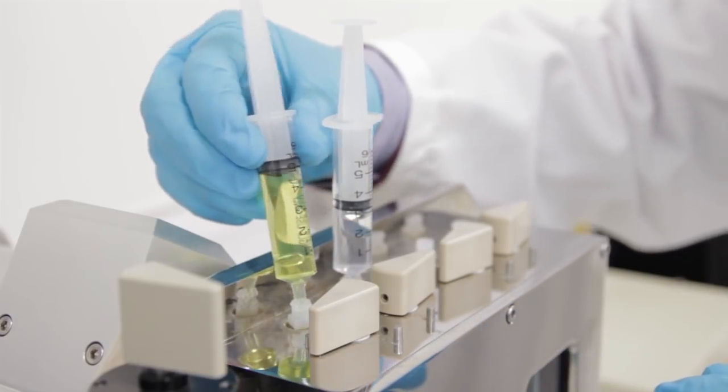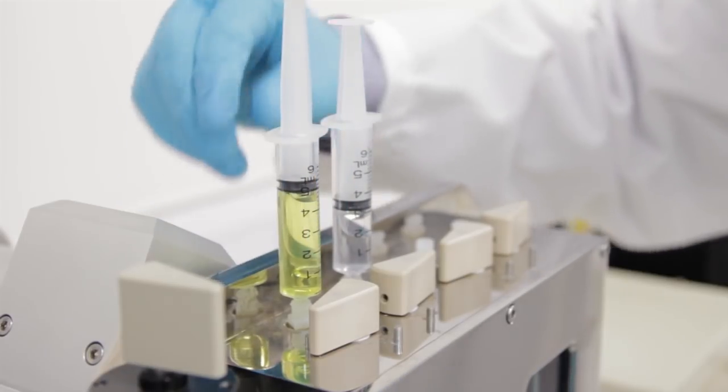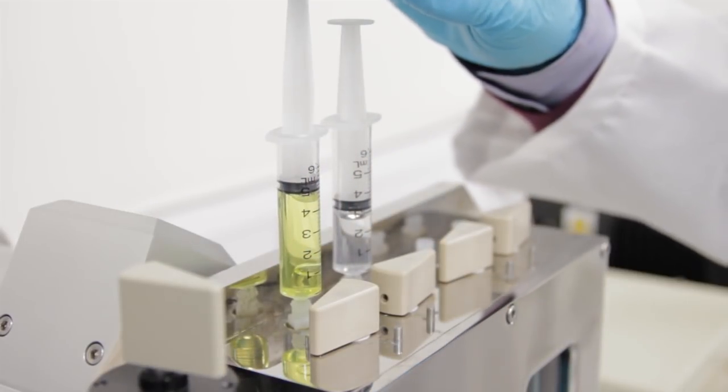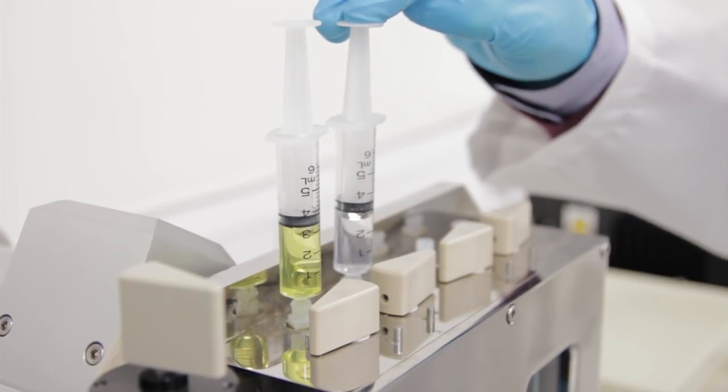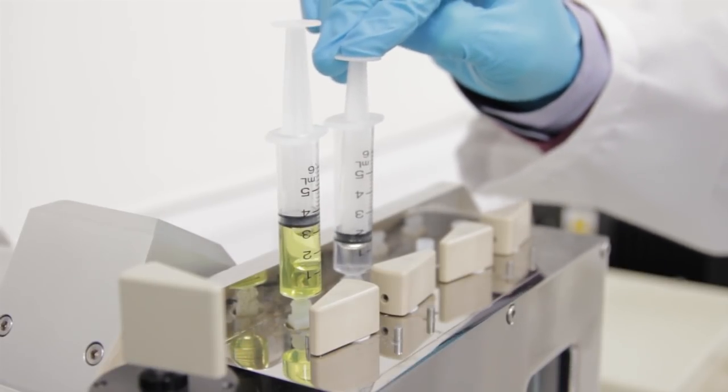Once the background has been successfully recorded, replace the solutions in the drive syringes with your reagent solutions, again making sure not to introduce bubbles. Set the drive valves to the drive position.